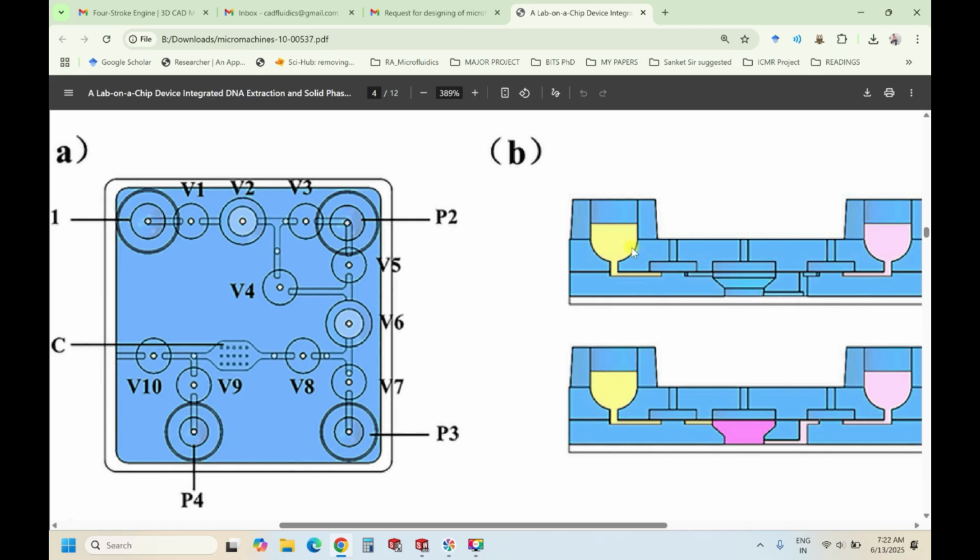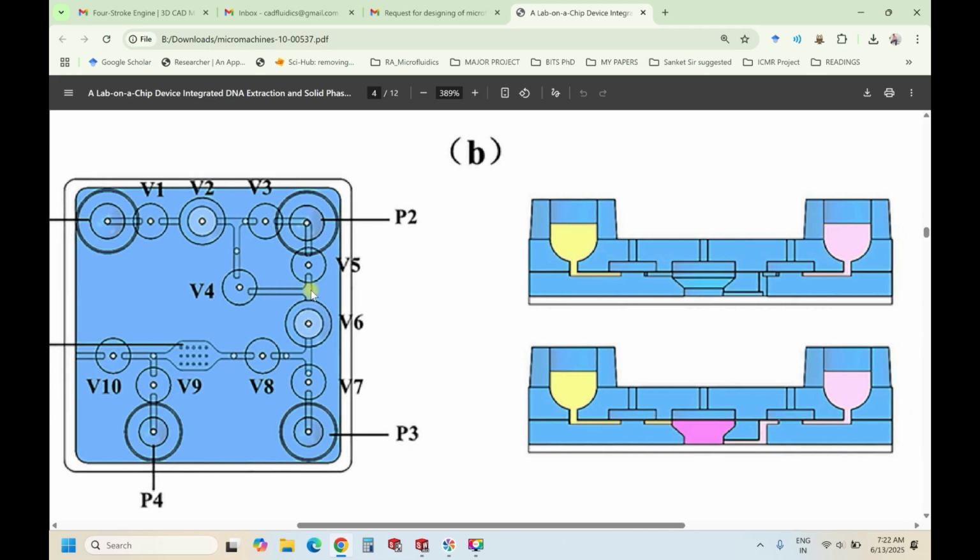This is completely made using PDMS, which uses the soft lithography process. Soft lithography has a few changes in the design compared to direct 3D printing. I'll explain the 3D printing currently, and then tell you how you can do it in soft lithography also. There is nothing much change. Basically in 3D printing, we remove the area as it is. But in soft lithography, since you need a pattern, instead of removing the area, you build the area. So if it is a hole, you build a cylinder, then pour the PDMS and get the pattern out of it. That is the only difference.